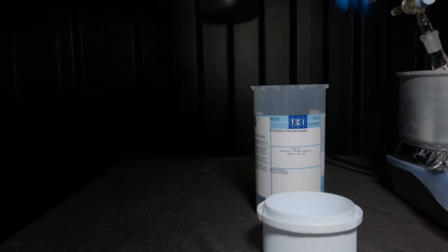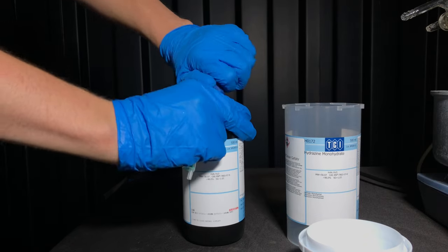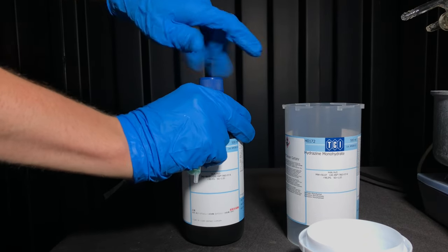Hydrazine hydrate is extremely toxic. I wore a gas mask and also had running ventilation while handling it. You can even see the bottles smoke a little although it was cooled in the fridge before.